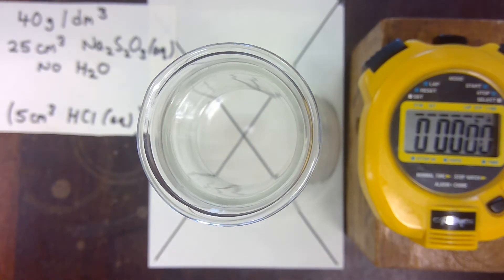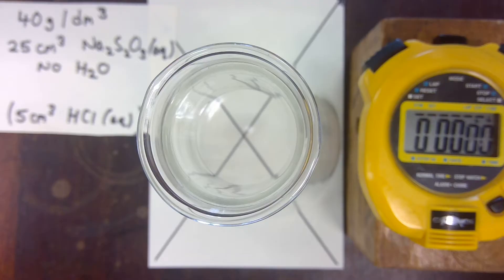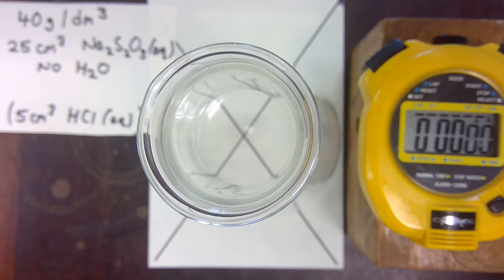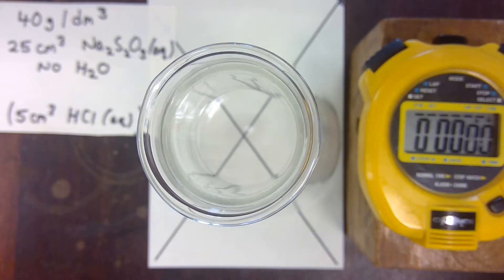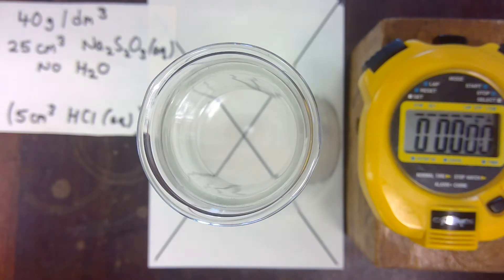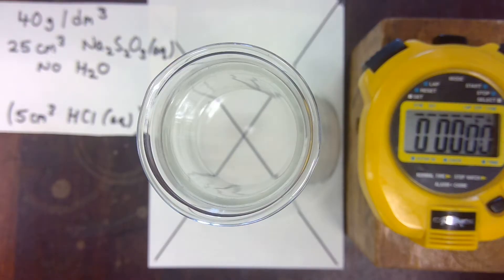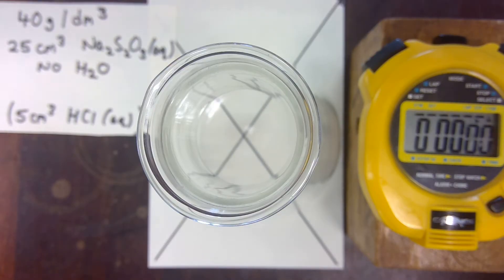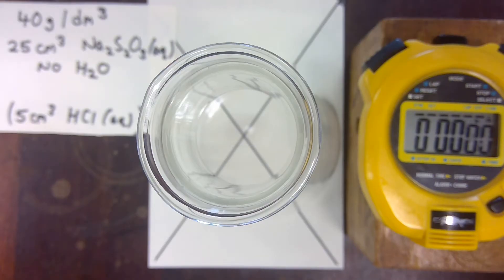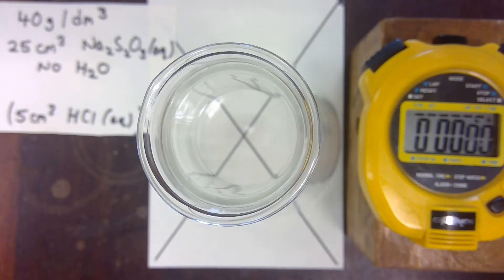This video looks at the reaction between sodium thiosulfate and hydrochloric acid, used to work out the relationship between concentration and the rate of reaction. In the experiment, sulfur is produced — a yellow solid. The production of the yellow solid will obscure the cross. The time taken for the cross to disappear is related to the rate of reaction: the longer it takes, the slower the rate of reaction.